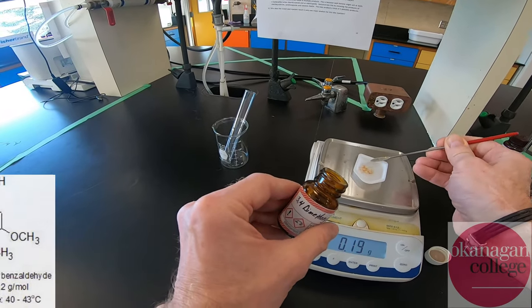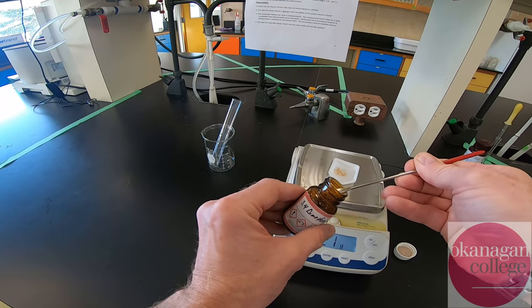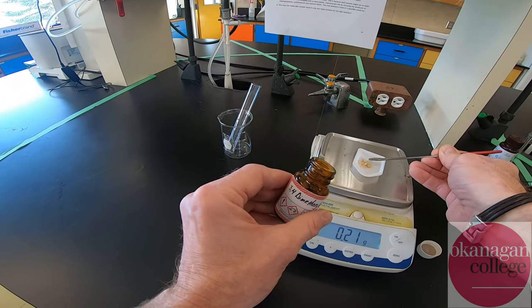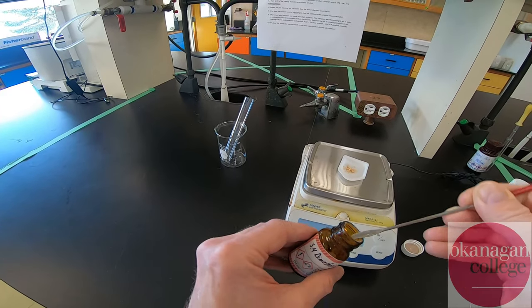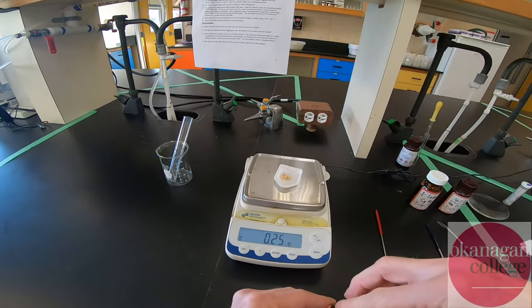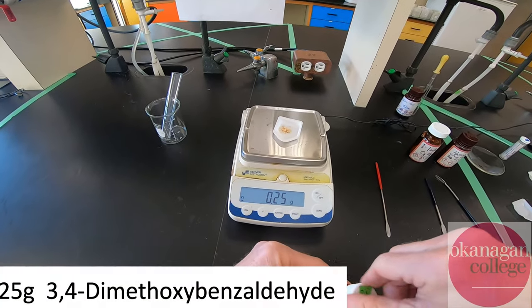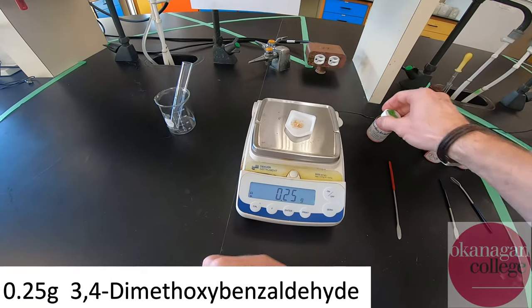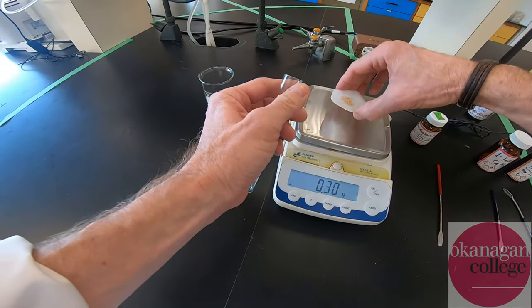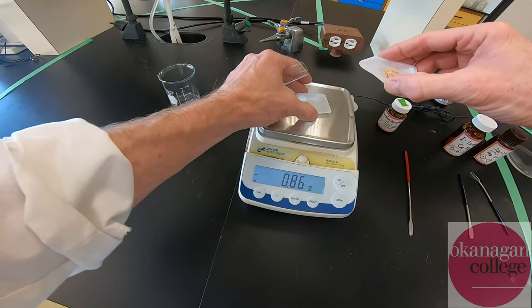We are going to try to do a yield calculation in this lab, but you'll see a little later that transferring this material is sometimes a little difficult. Also we're going to do a recrystallization. We're going to record that as 0.25 grams of the benzaldehyde, and I'm going to transfer that into our reaction vessel, which is a good old-fashioned garden variety test tube.